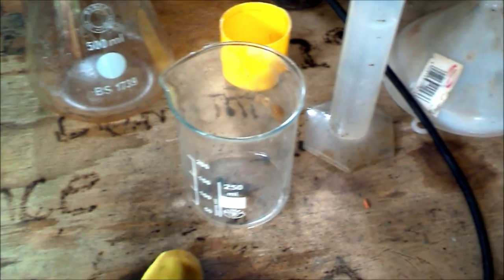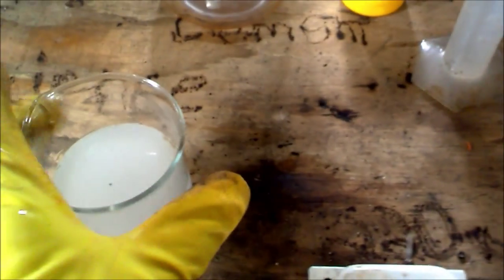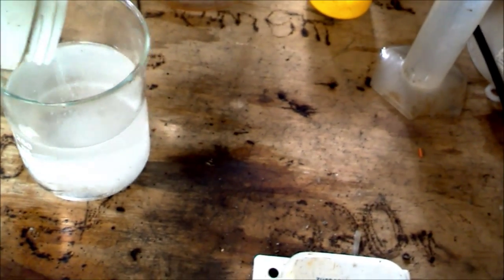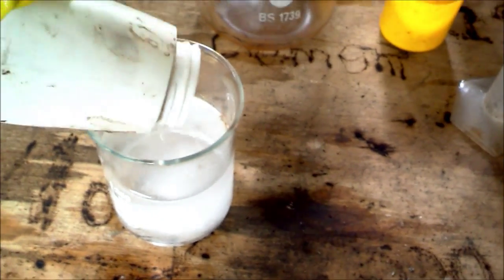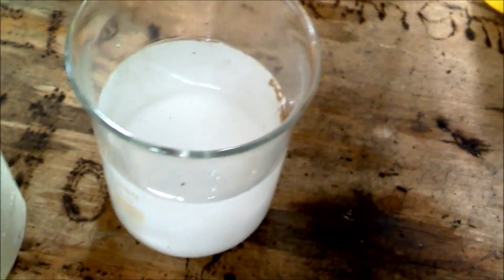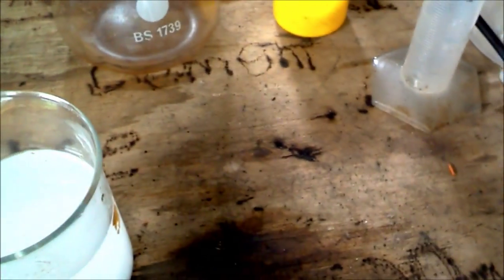First, get a rough amount of water and take some sodium hydroxide. Sodium hydroxide is corrosive and toxic, so be careful when using it. Add a rough amount of sodium hydroxide. The solution will heat up, which will actually favor the reaction of ammonia.